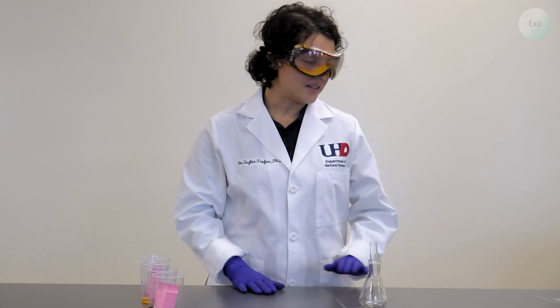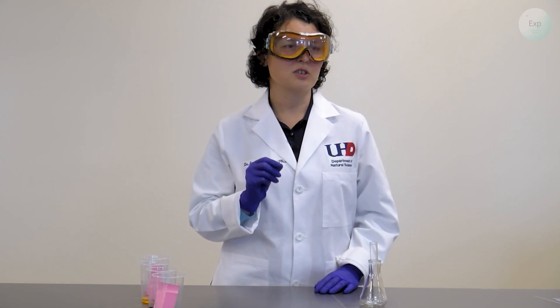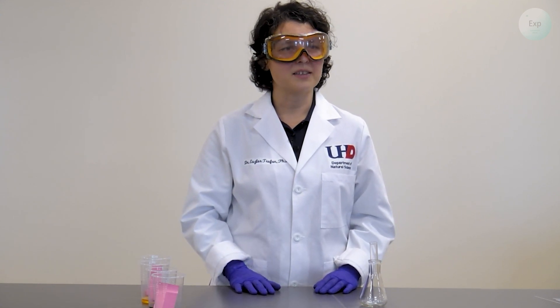To do the layering successfully we need to add the solutions very, very slowly so this is where good pipetting skills will be essential.